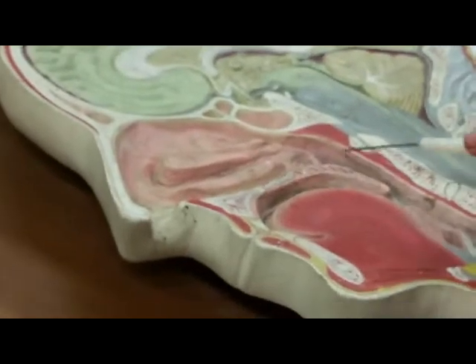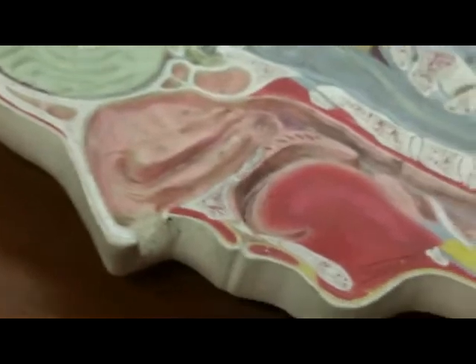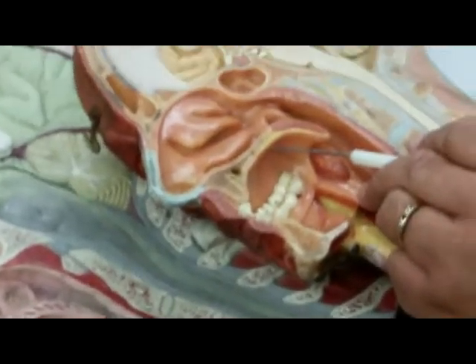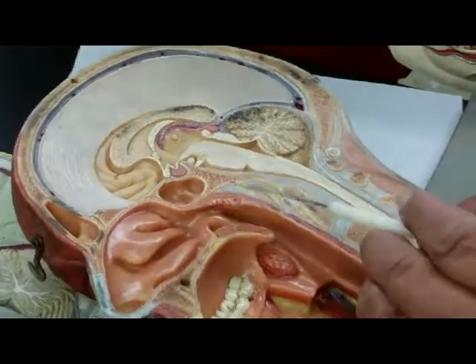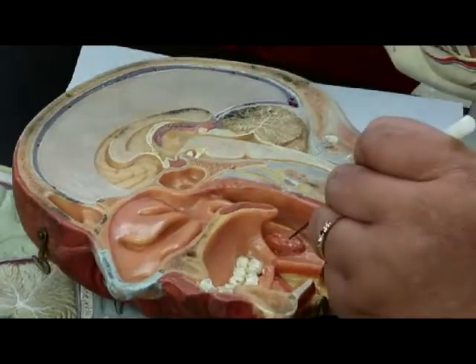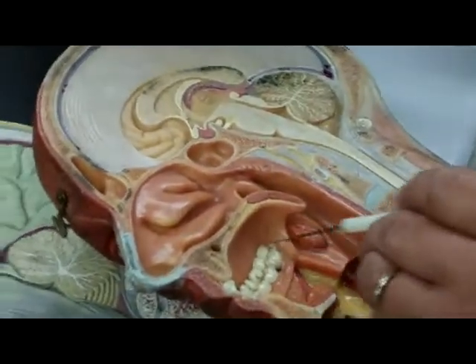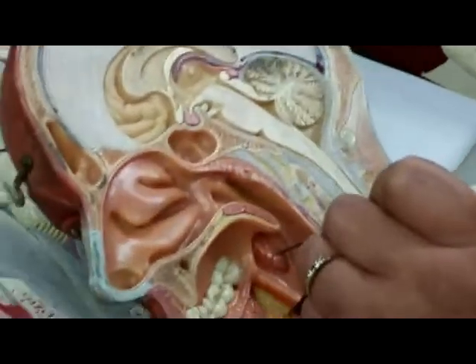So here you have, this would be the nasal tonsil, and then there's one in there, it's a better model to show the oral cavity. Again, it shows you the hard palate, soft palate, and the V structure is the uvula. This right there is the palatine tonsils. This is the oral cavity. Tongue was taken out. This is the palatine tonsil that is tested.